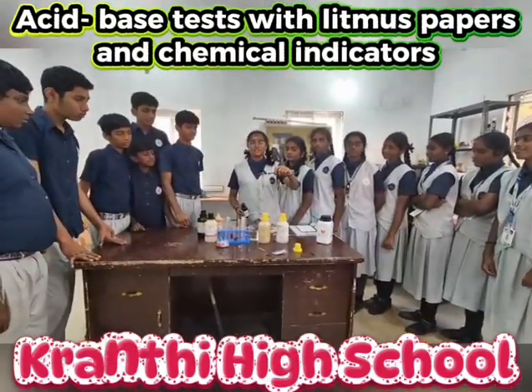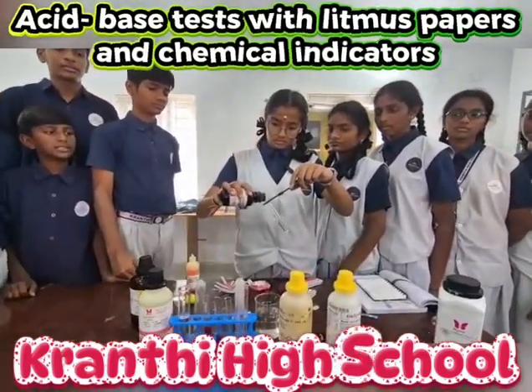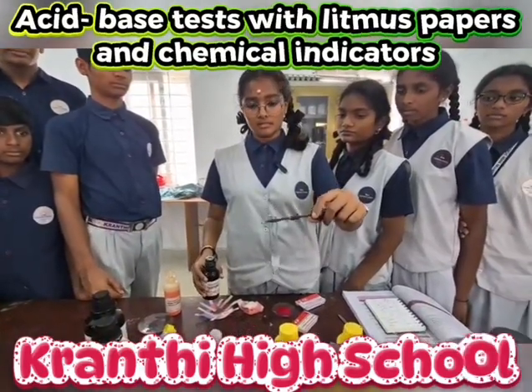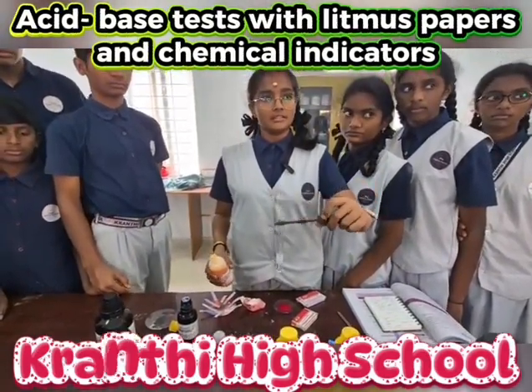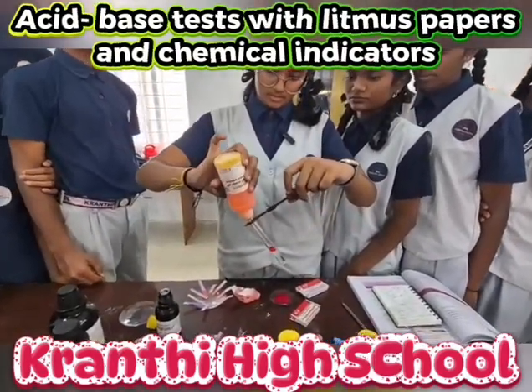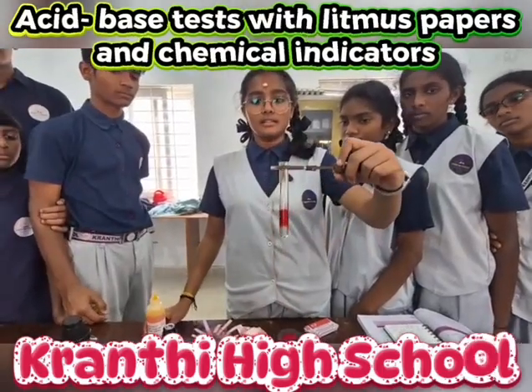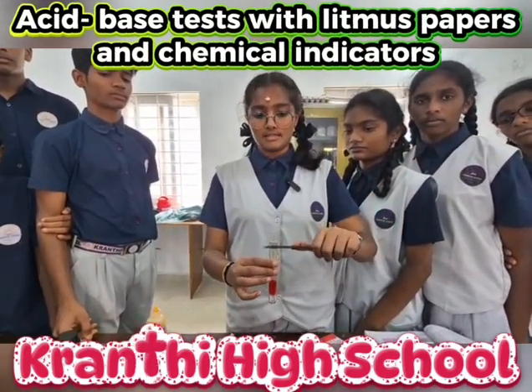Now we are testing HCl, which is diluted. Now I am adding phenolphthalein to it. As you see that its color changed into white. Now I am adding methyl orange to it. As you see that HCl solution has turned into red color, so we can consider it as acid.